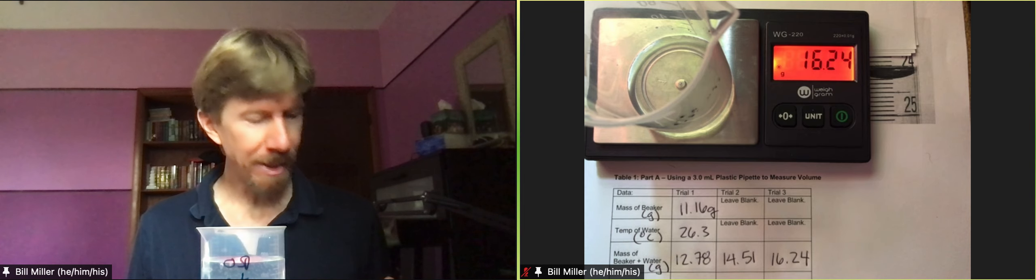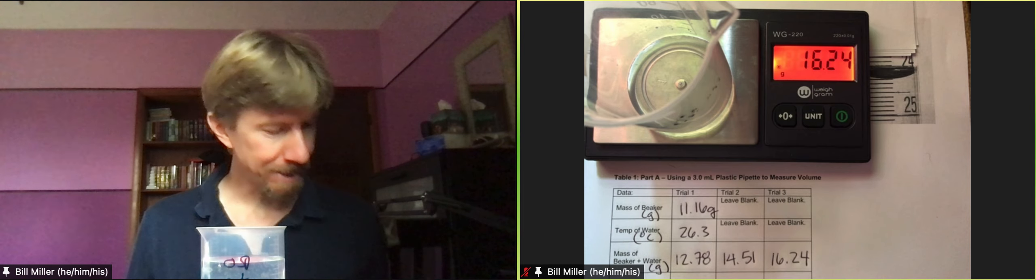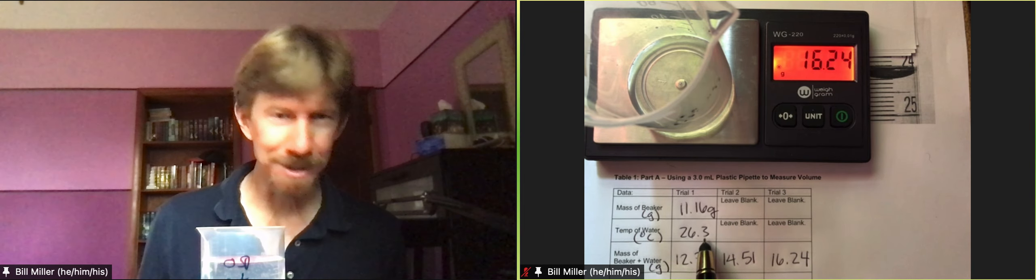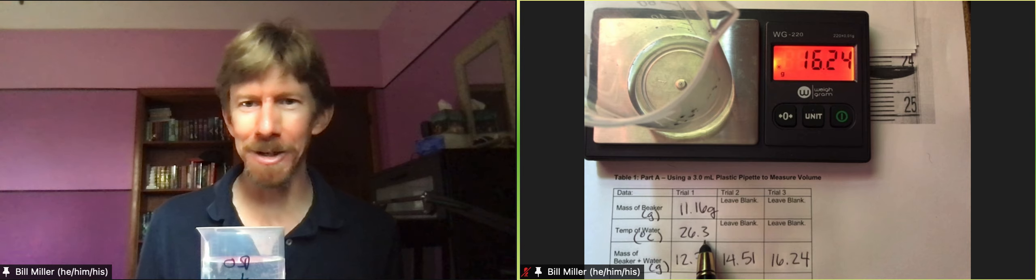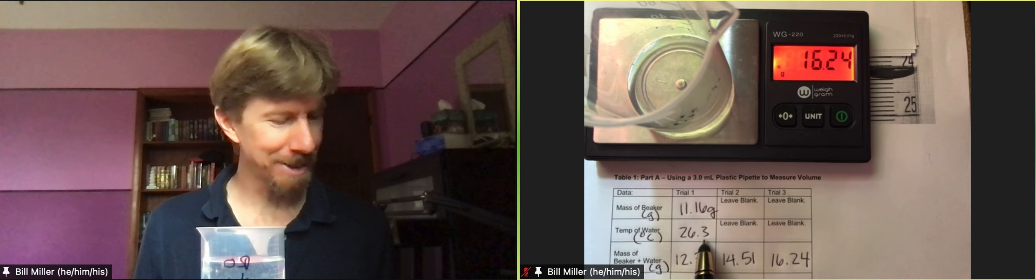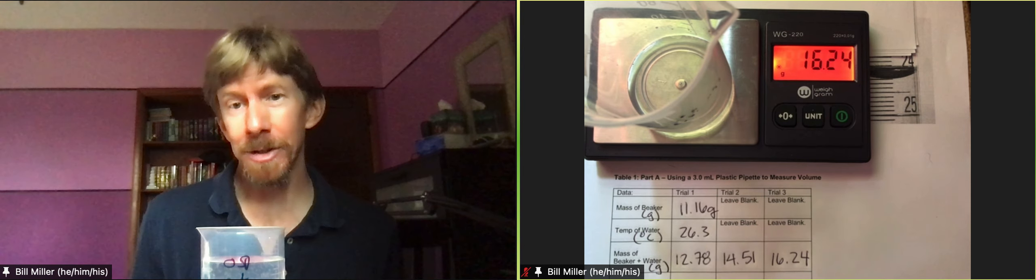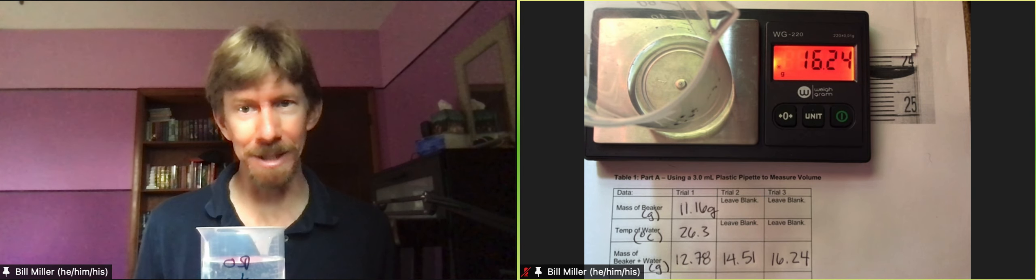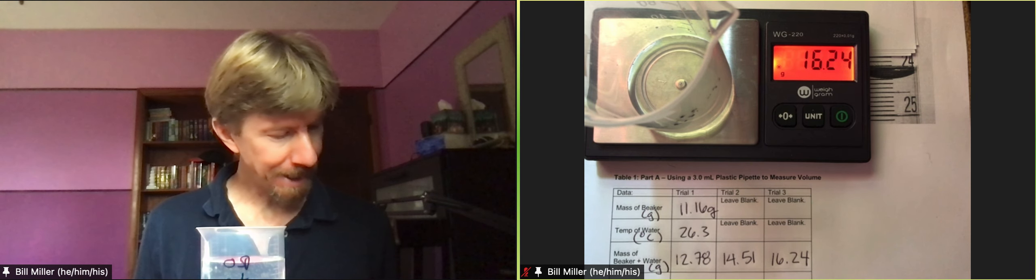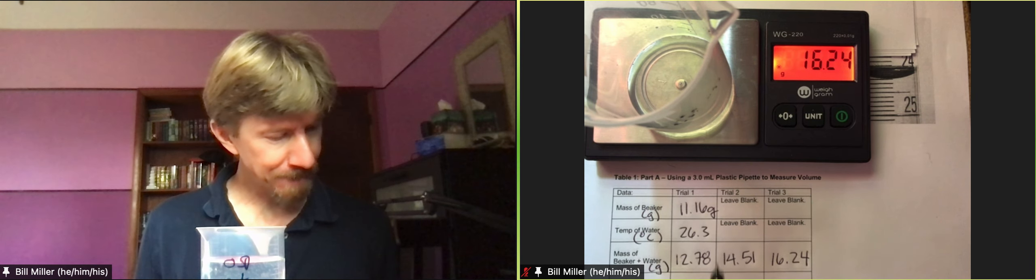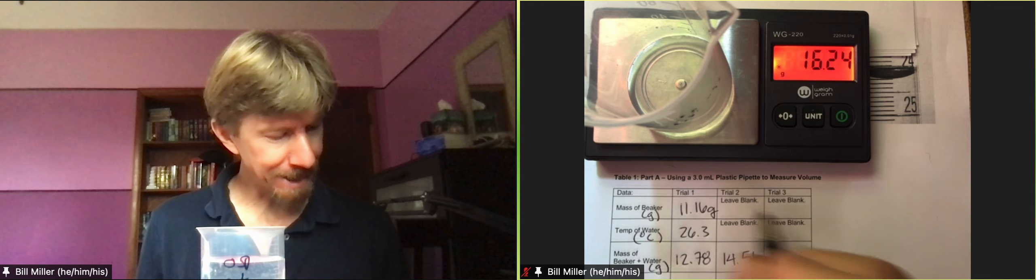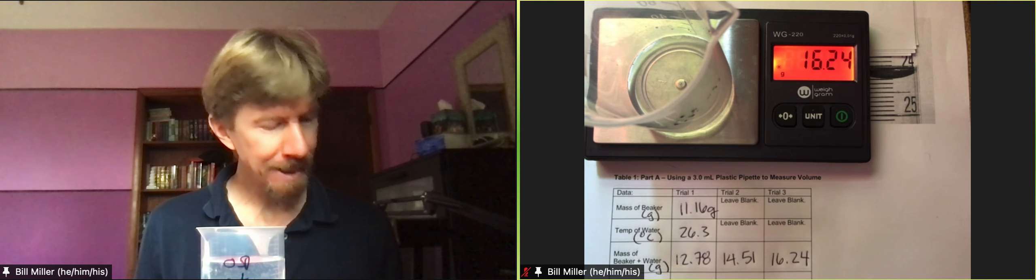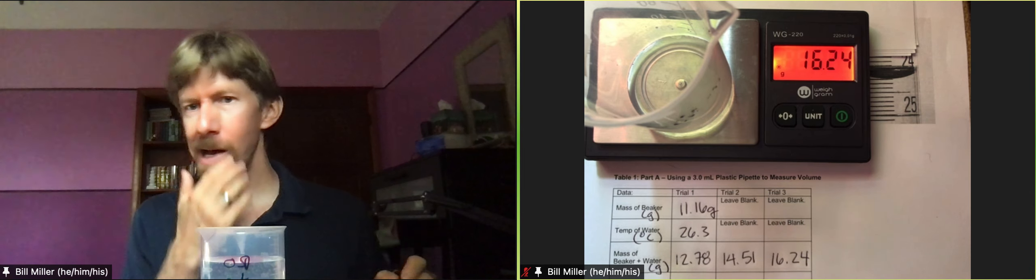That is the data. Yeah okay good I saw just this one digit here and I thought I forgot to write down the other digit but for temperature there's only a tenth space and we always write down all the digits even if they're zeros. That's the data for this step.